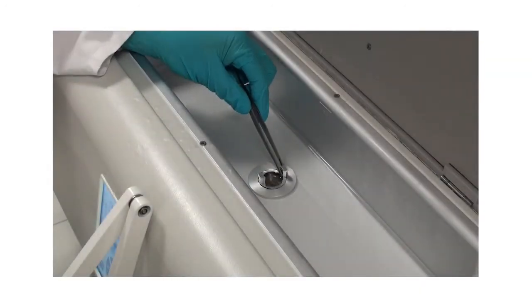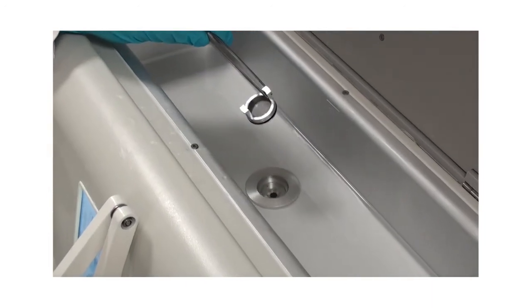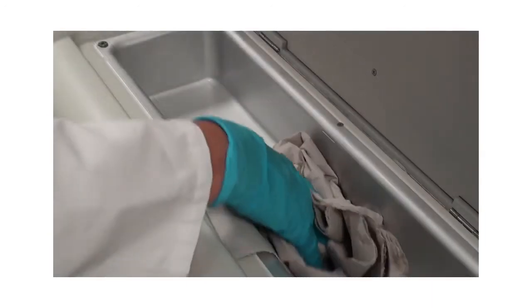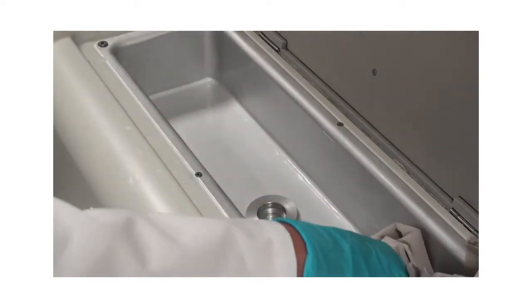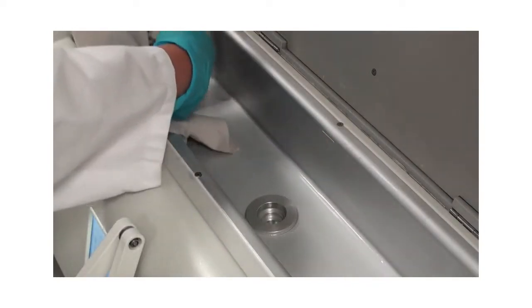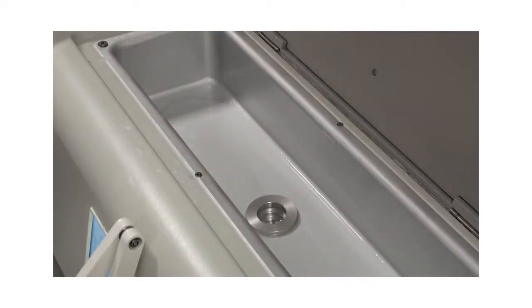To clean the paraffin tank, either empty it or clean it prior to refilling with new paraffin. Take out the filter and clean the work tank with paper tissue. If necessary, use xylene substitutes and paraffin remover.